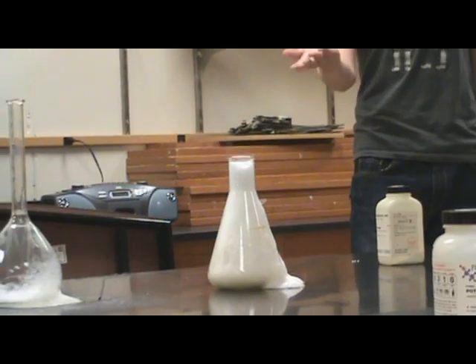It's so weird that this did not happen the first time we tried this. It happened in that one, but it didn't happen the time we tried it before this. And yet it's happened twice now. Probably because we're using dirty glassware — that's probably it.